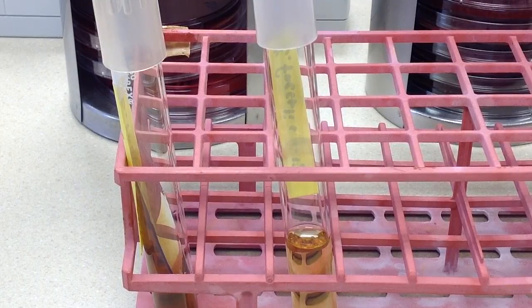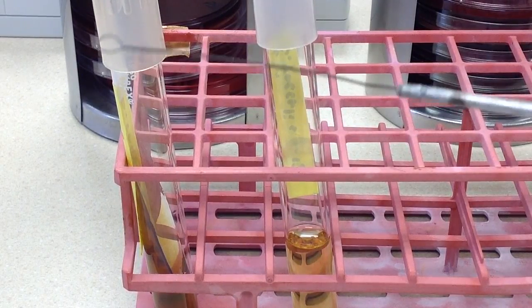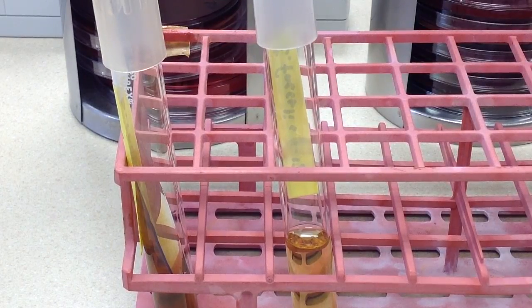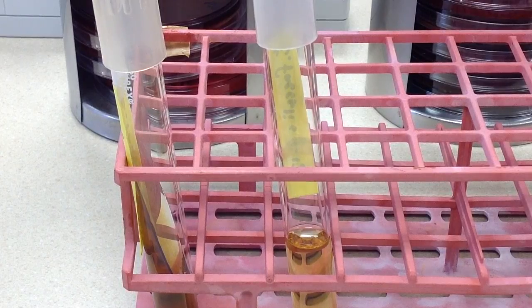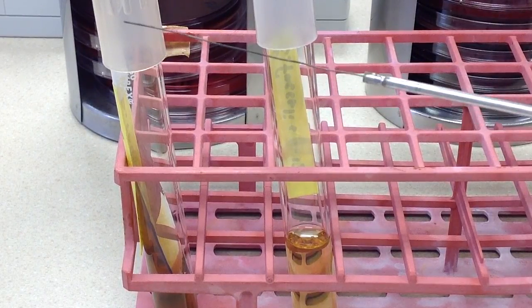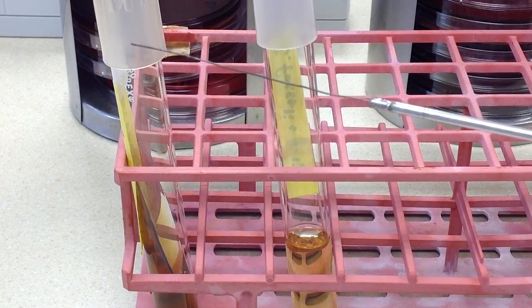When we are using plates, we often times use, here we have a loop, but there is another tool that we can use, and that is the inoculating needle, which you can see is just the same as the loop, except it doesn't have a loop on the end of it.